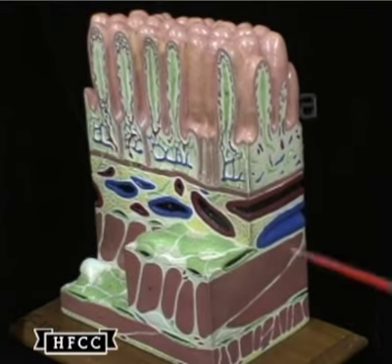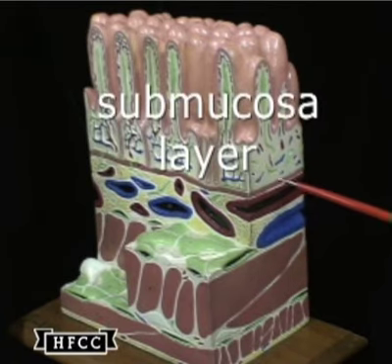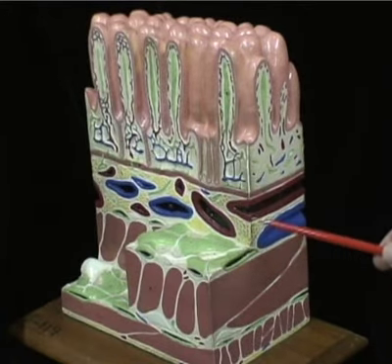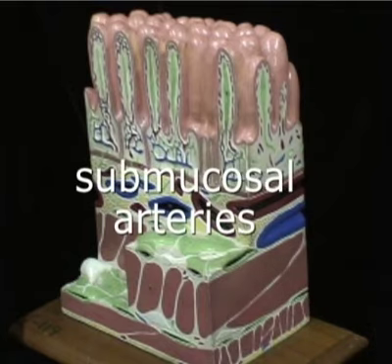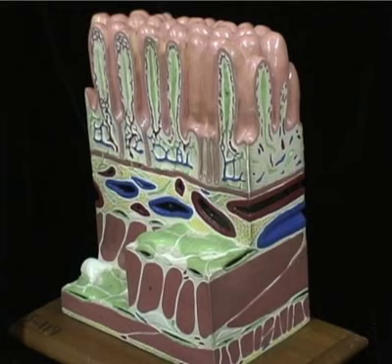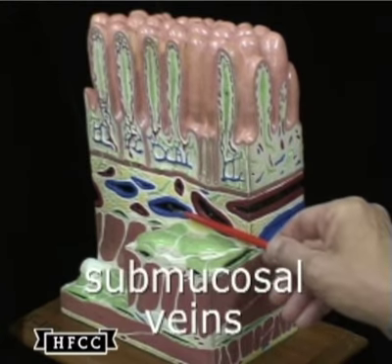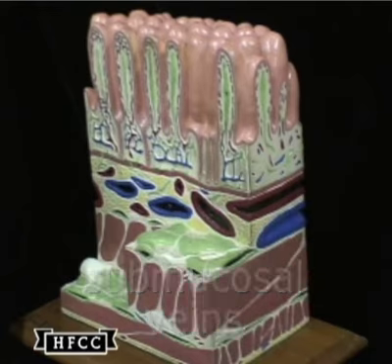The third tissue going inward toward the center would be the submucosal layer. It contains arteries, veins, and nerves. Detailing those, in red would be the submucosal arteries, and then in blue would be the submucosal veins. These are systemic arteries and veins.